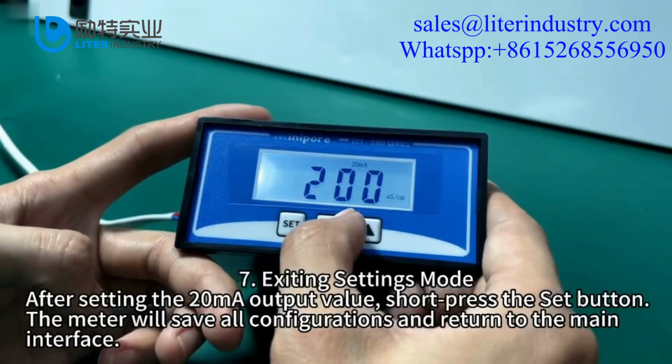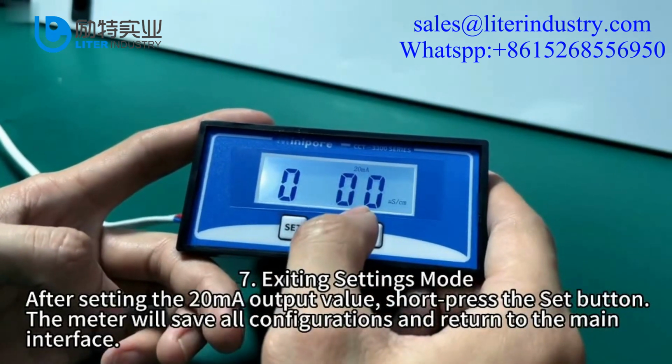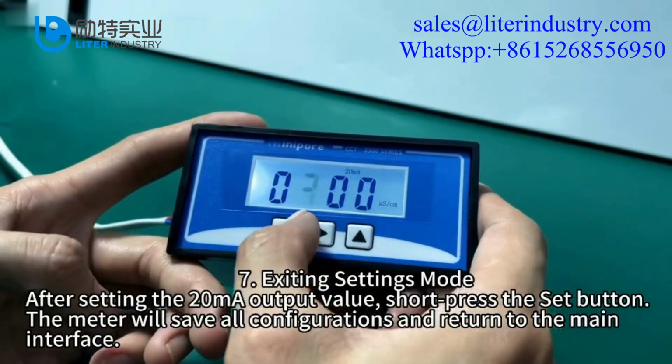Exiting settings mode. After setting the 20 mA output value, short press the set button. The meter will save all configurations and return to the main interface.